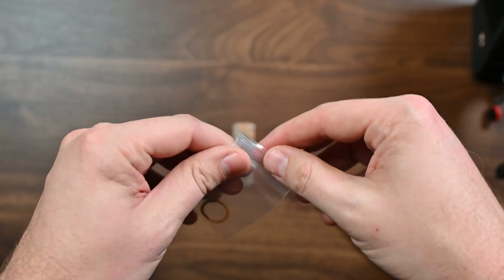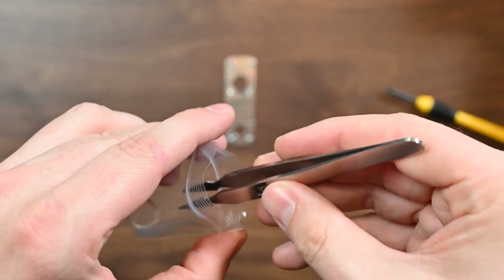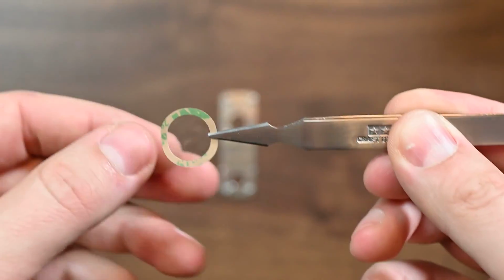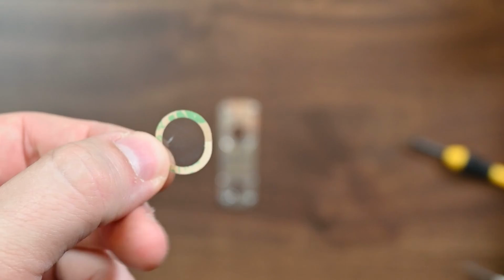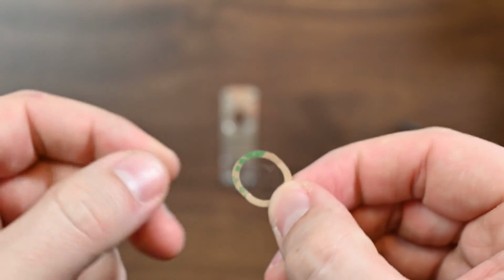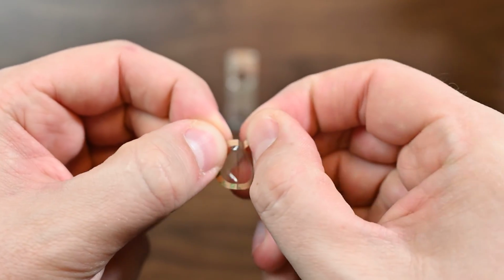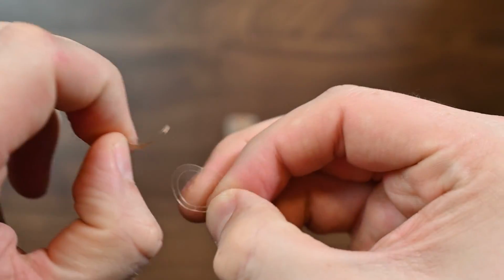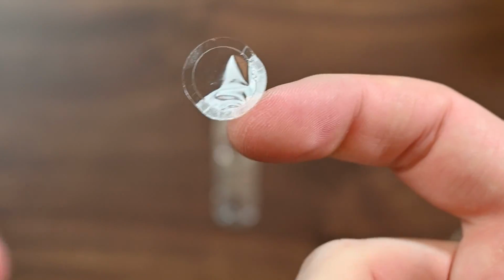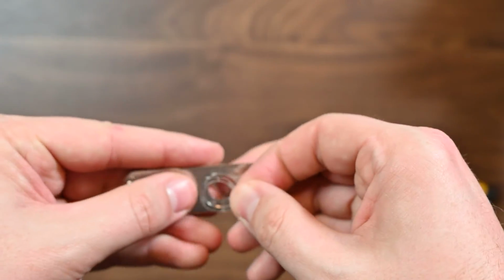Find a new window for your analyzer, and what you're going to do is make sure that whenever you're touching this window, you're always careful not to damage the inside plastic. You can see in the light that this window is intact. It means it's not ruptured, it's not dirty. In the center, there's going to be these tabs that you just peel away. All right. So part of the reason you want clean hands when you're doing this is because anything on your hand is going to stick to that adhesive, and that is going to impact your results.